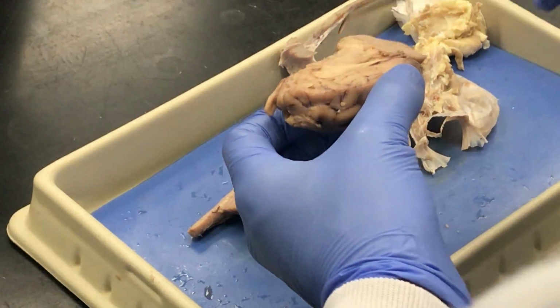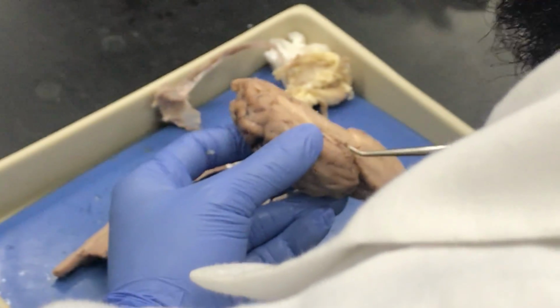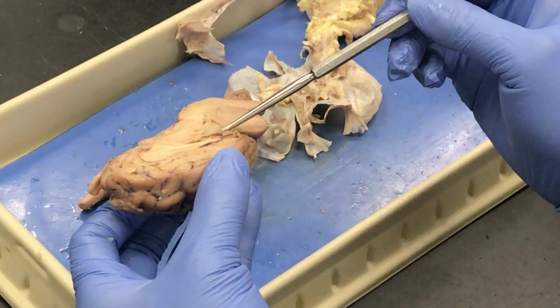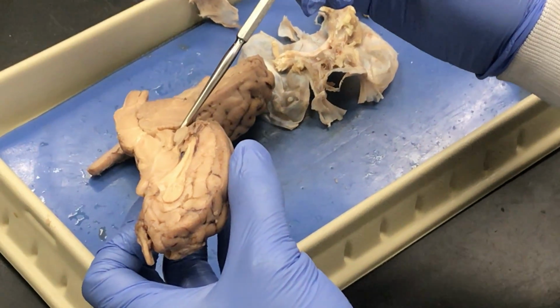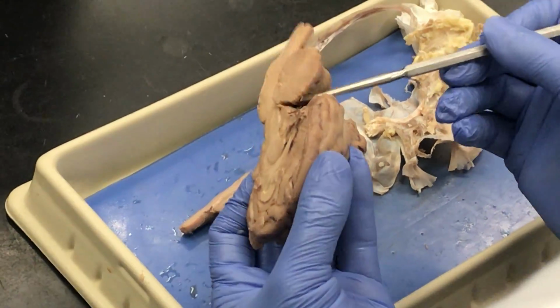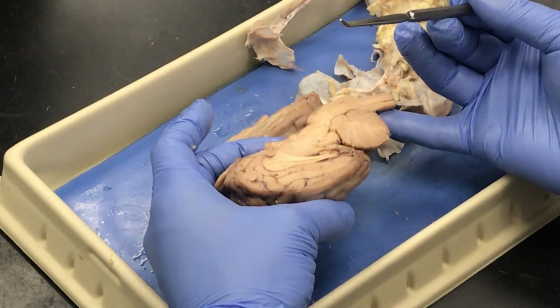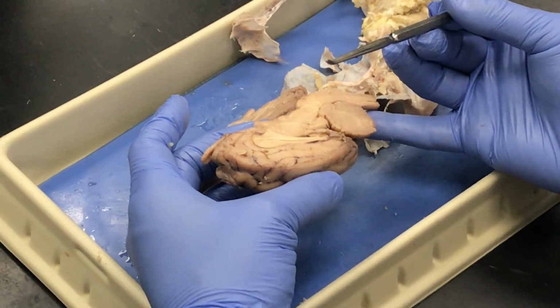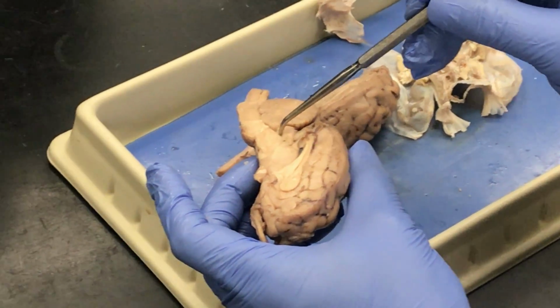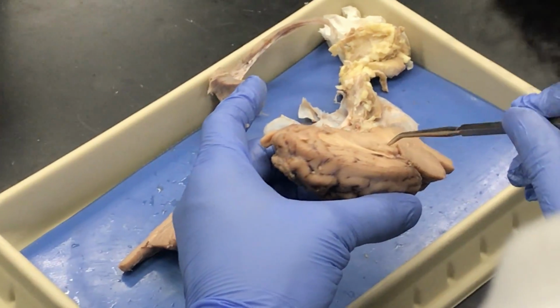The pineal gland. So that's why I really like your specimen here. You have to cut right in the center to get the pineal gland. So it's this little section that I'm lifting up here. And it points out it's dorsal to the superior colliculus. You see that over here. Then you've pointed this out, but the aqueduct of the midbrain is that channel. Between the cerebral peduncles and corpora quadrigemina is the cerebral aqueduct.